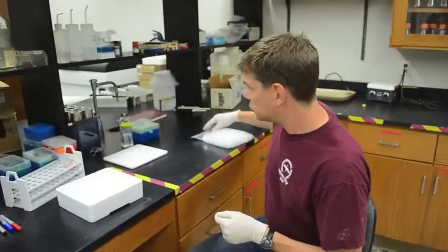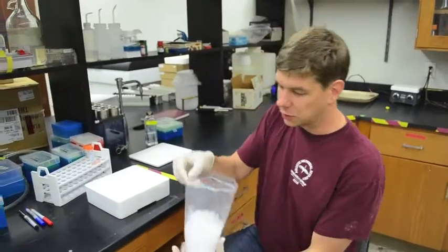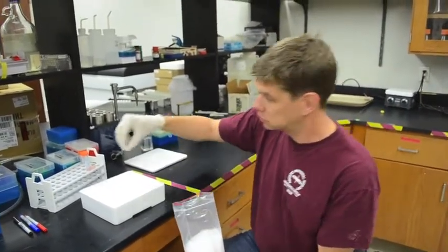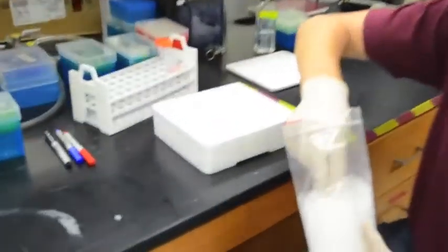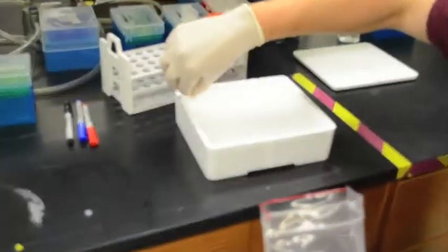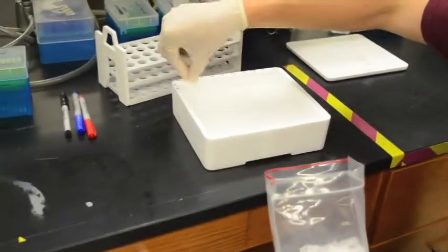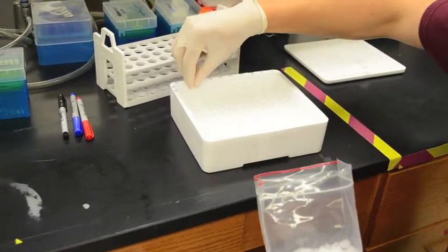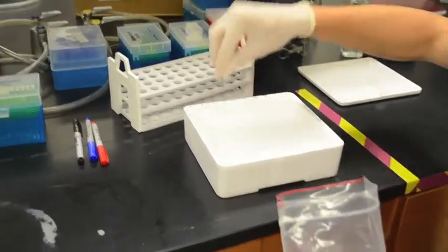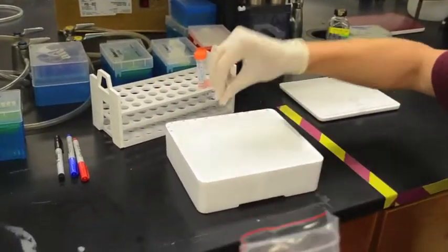So now that we've got everything we need in each vial, the last thing to do is put a cap on each vial. You want to make sure to do this with clean hands. If you think you've got substrates or something like that on your hand, you'll want to change your gloves, because you have to put your hand into this big bag. And you don't want to get substrates or anything else all over these caps.